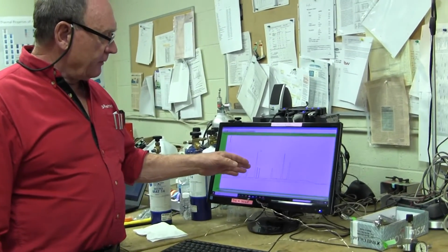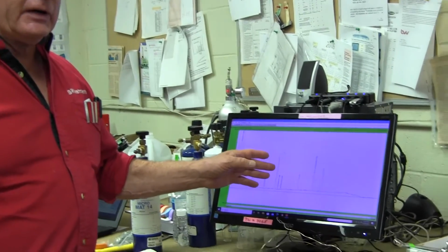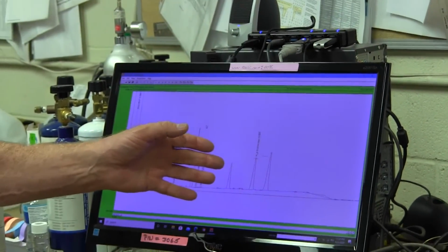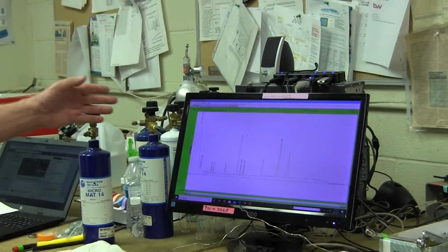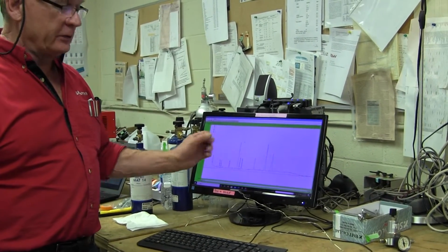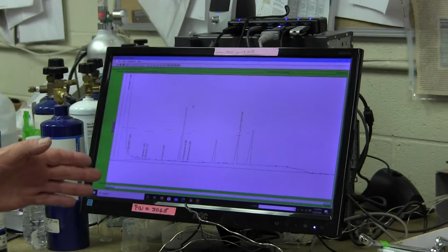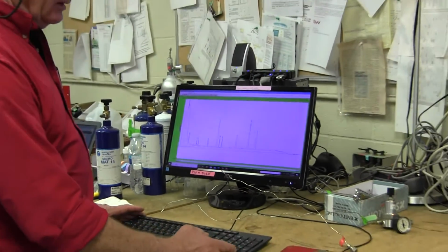Today we'd like to show a short video as to how to locate the PEAKWIN.INI file. If this file is corrupt or missing, then PeakSimple doesn't act normally. There are a couple of things that are tip-offs to that. One is that the temperature doesn't communicate between the computer and the GC, but the data does. That's a tip-off for sure. And then also, if the chromatogram starts by itself without your telling it to start, that's also a symptom of this. So we need to find the INI file.